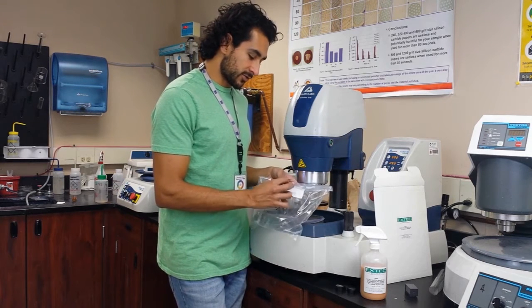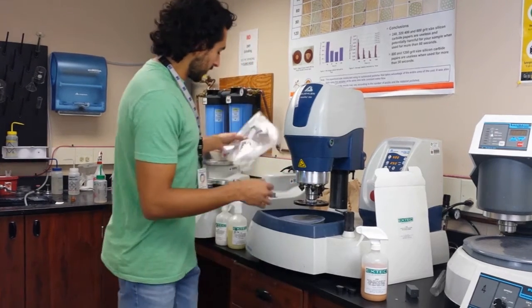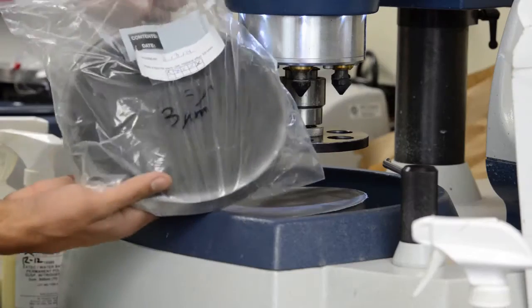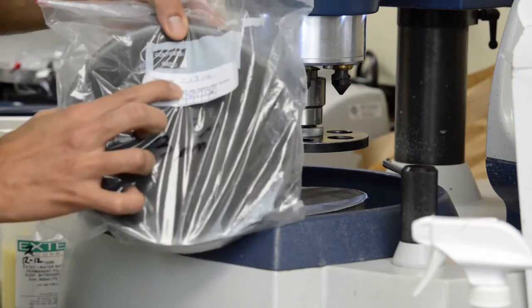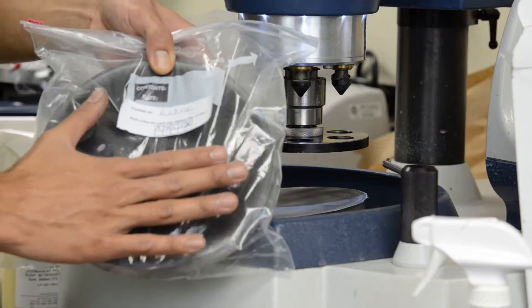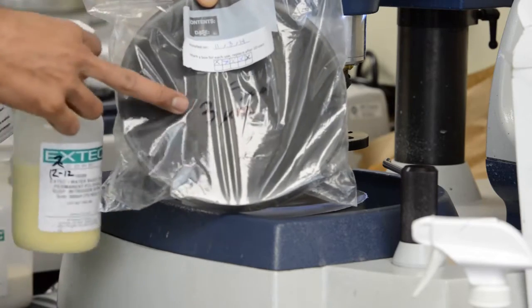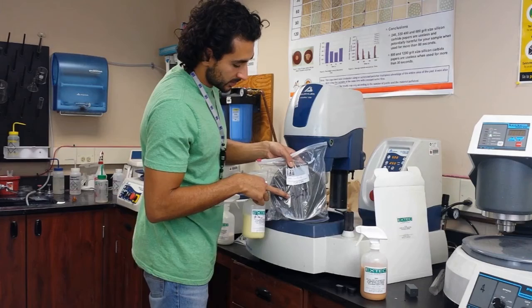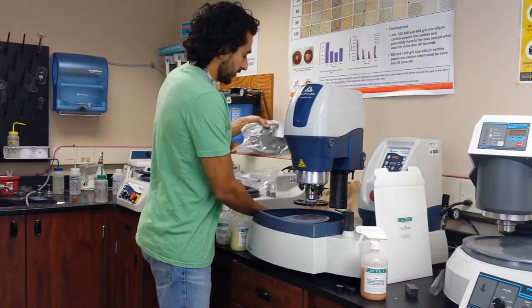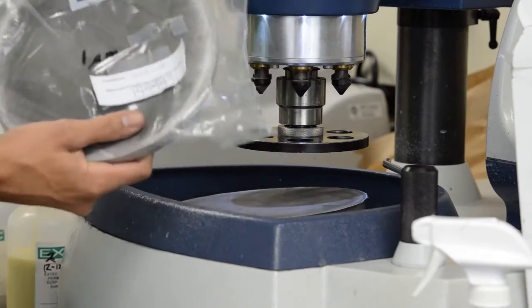For demonstration, I'm going to remove the used one and start with a fresh one. I have a 3 micron here that was installed on a certain date and used only five times. Once we jump to 3 micron, we'll use that dirty pad — dirty doesn't mean bad. And here's the 1 micron, same thing, in its own Ziploc bag to avoid contamination.